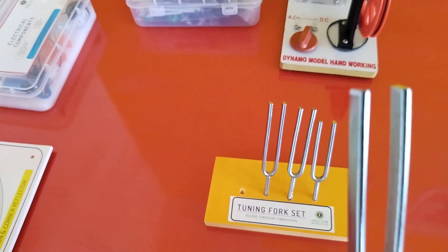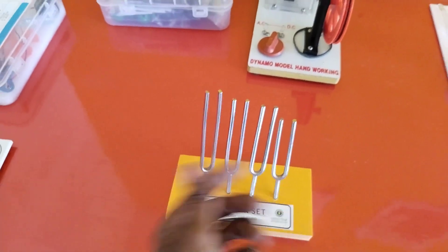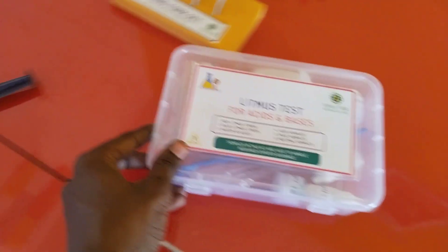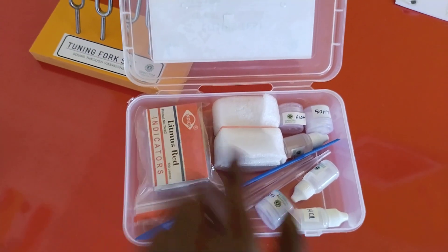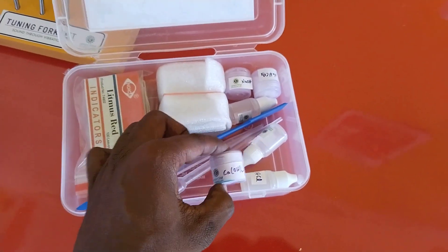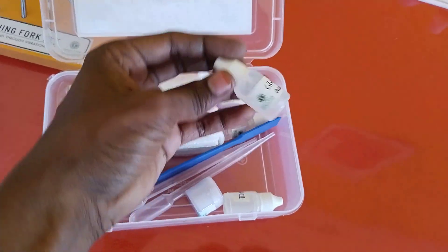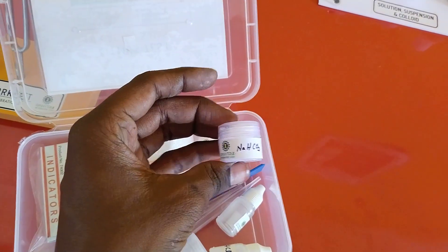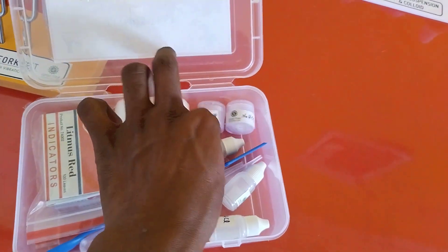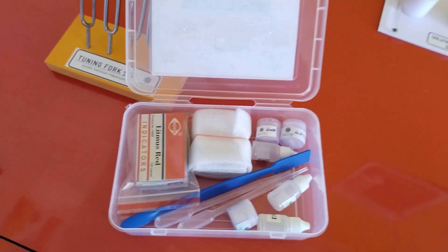Different tuning forks have different tuning frequencies — that's how it works. We have litmus test blocks. Using litmus red and litmus blue we can check the acidity and basicity of different materials like calcium hydroxide, hydrochloric acid, citric acid, sodium hydroxide, sodium bicarbonate, and acetic acid. With this we can check different acids and bases available in our home and daily life.